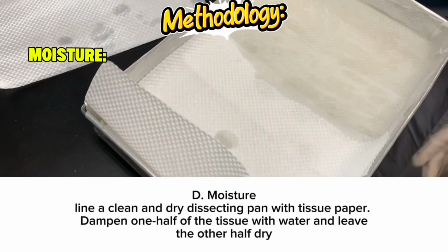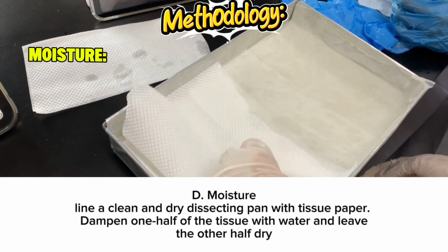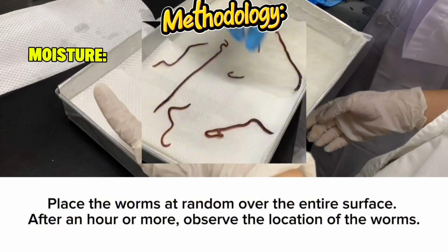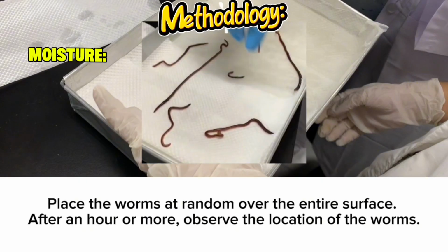For the moisture, line a clean and dry dissecting pan with tissue paper. Dampen one half of the tissue with water and leave the other half dry. Place the worms at random over the entire surface. After an hour or more, observe the location of the worms. Where will the worms go?